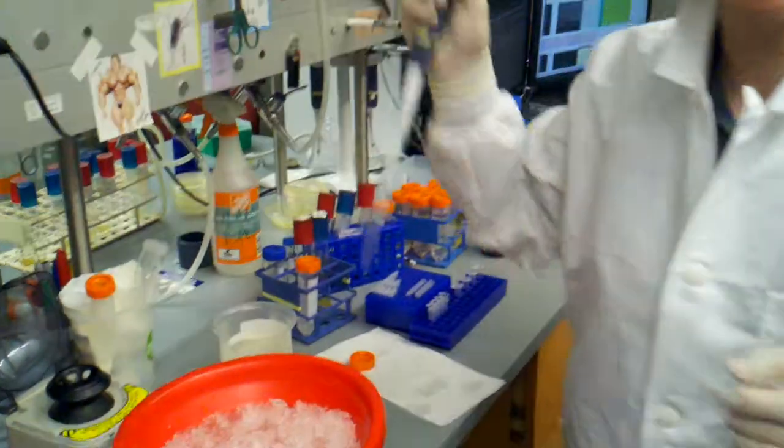And now I'm just going to resuspend with the glycerol, do this a few more times, really try to clean off my cells, and then we'll come back for the electroporation.